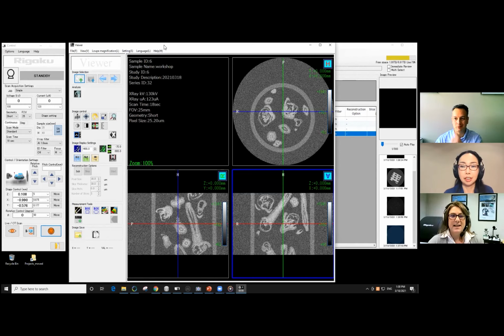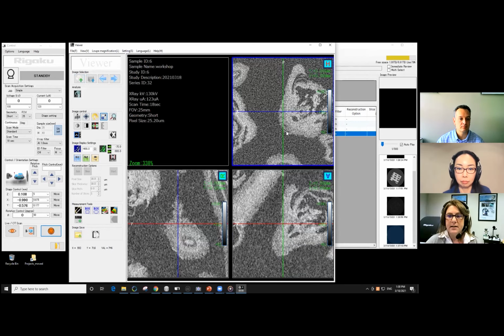Yes, there is. That's a good question. Basically, you need at least 2 voxels to see a feature, and a feature could be an edge. It could be part of this, let's say, these small voids in here. If that void is 5 microns, then you need at least 2 voxels or 2.5 microns to even see it. But ideally, it should be much smaller, say 1/4 to 1/5 for the voxel size.